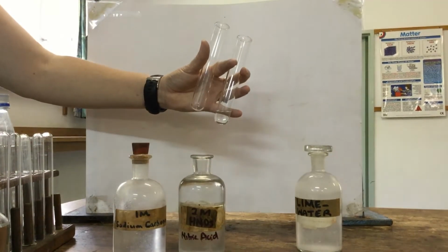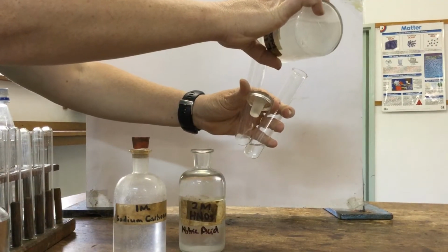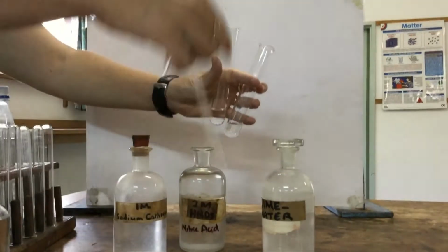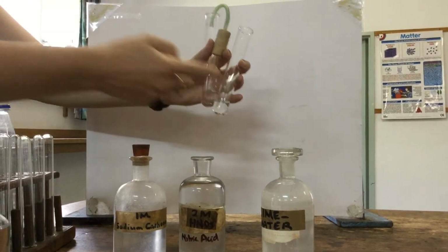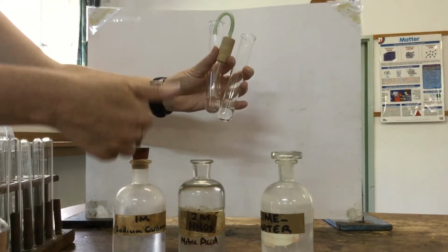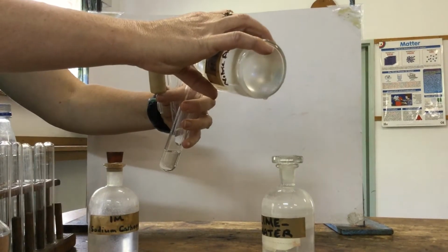Carbon dioxide is produced. So we're going to put some lime water in a second boiling tube, and we're going to place the delivery tube. The delivery tube will deliver the gas, which will bubble through this lime water if a gas is produced. Okay, so we know this is a carbonate, so this is the positive test for carbonate. So we're going to add some more nitric acid.